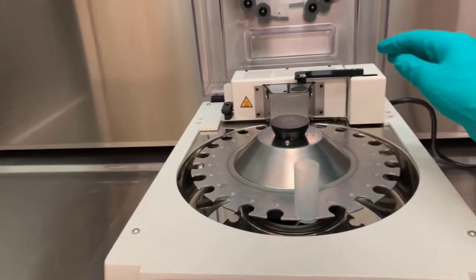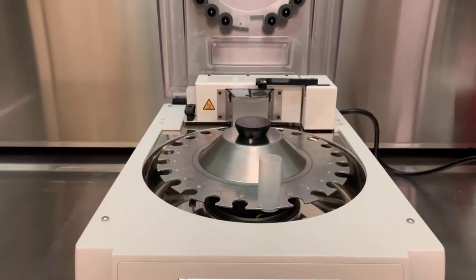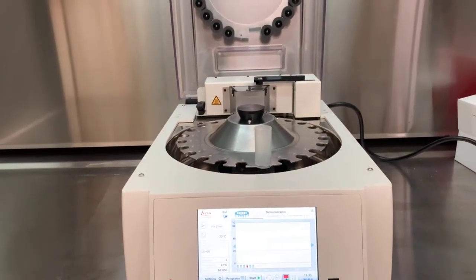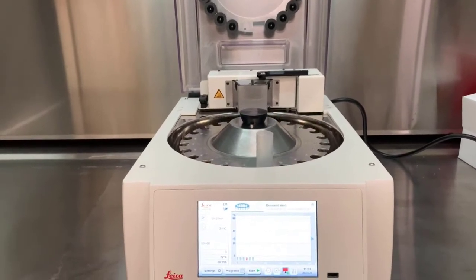The specimen arm, which will hold a completed basket assembly, will lower the samples into the initial vial of the program.